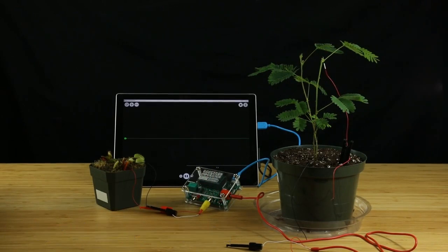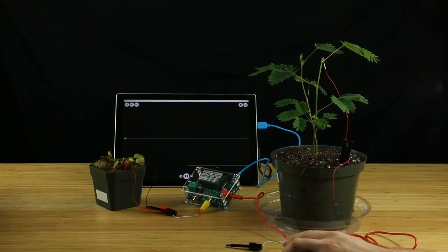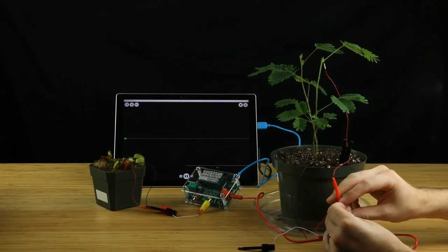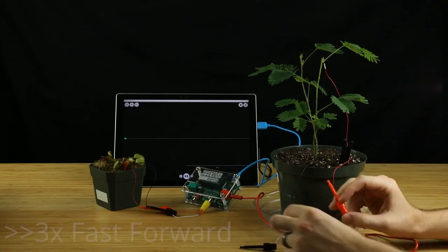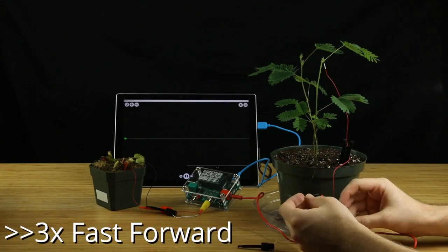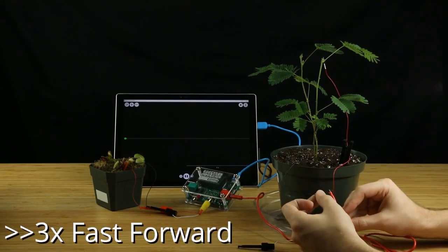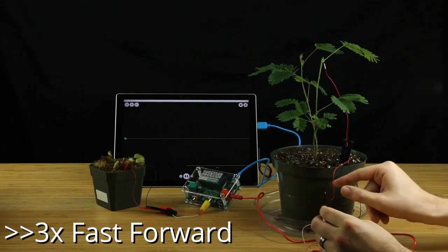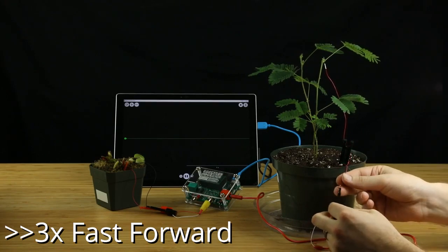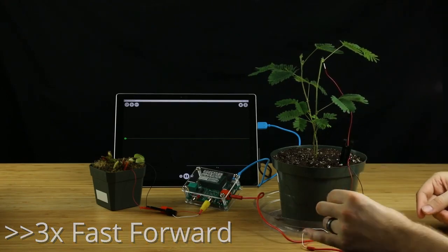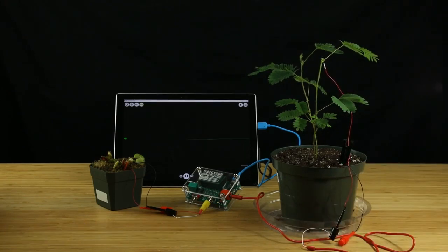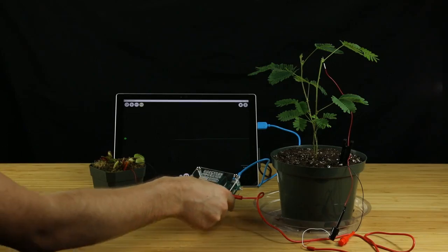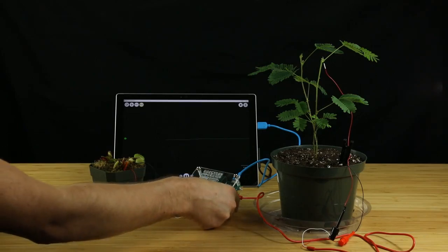But then, for the sensitive mimosa, we're doing something a little different. Following out the red communication cable, take the red clip and attach it to the black grounding wire, and the black clip attaches to the red recording electrode. We switch this up from the recording when we do the stimulation experiment because of some electrical engineering shenanigans.